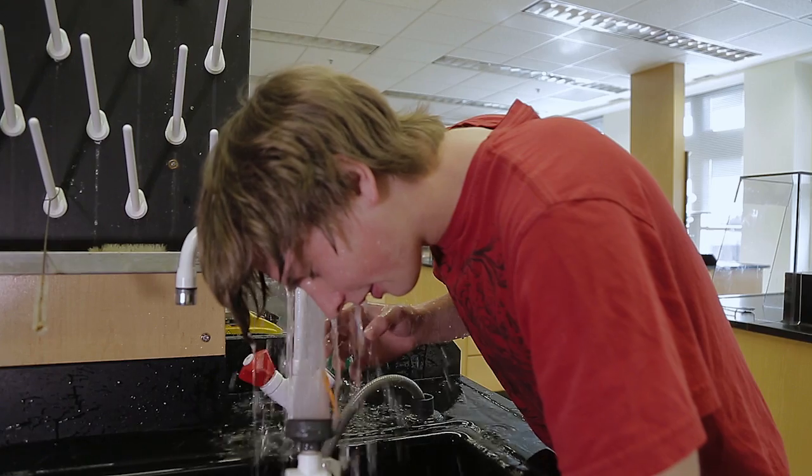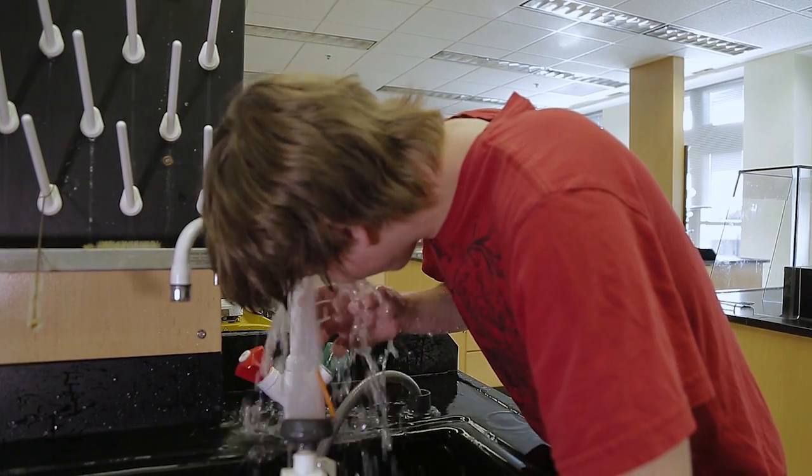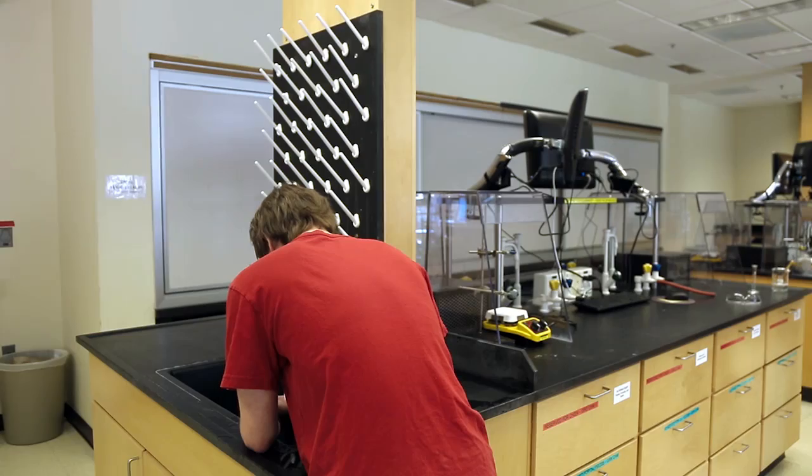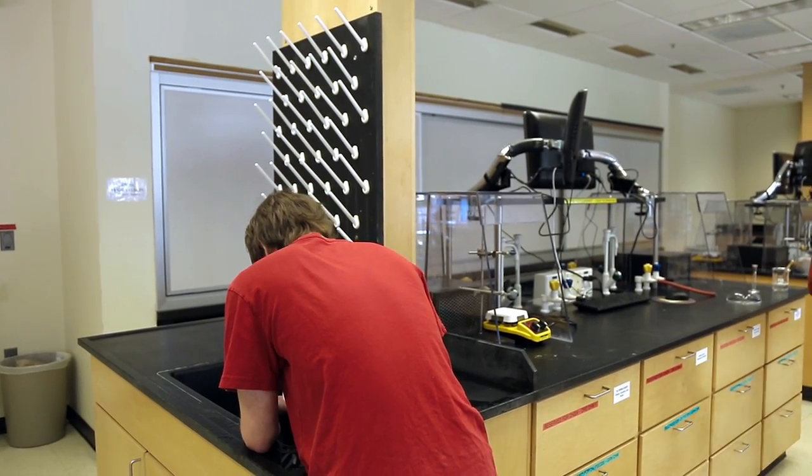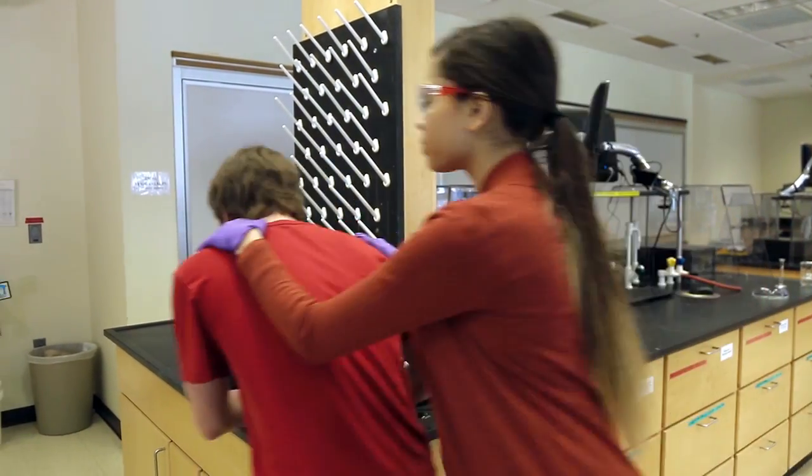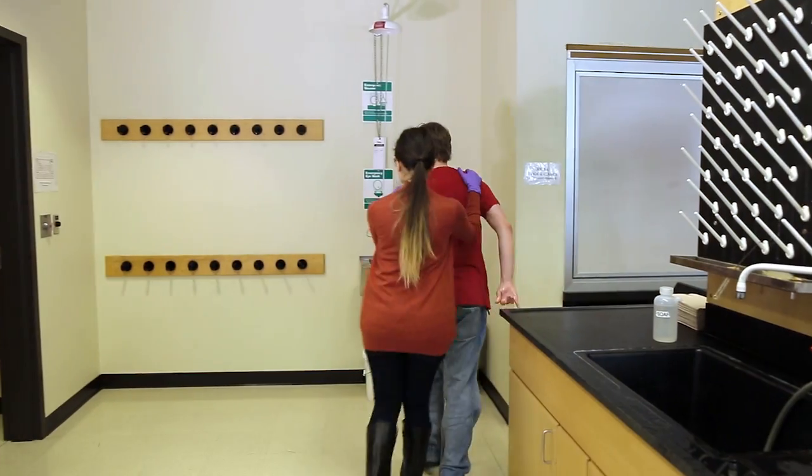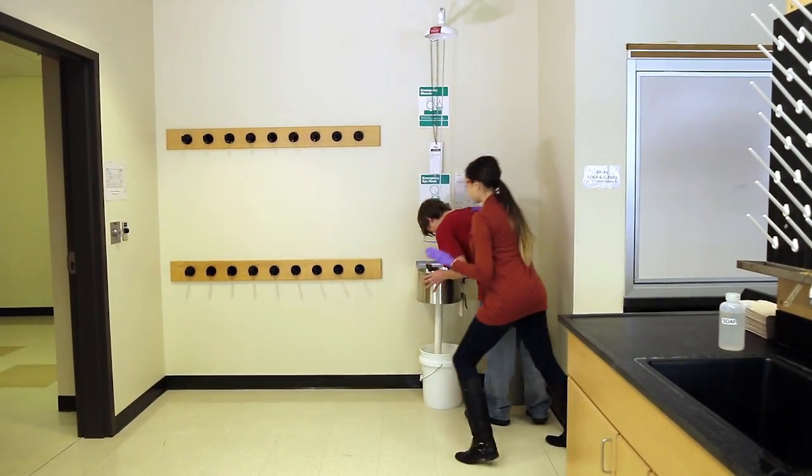Do not try to remove your contacts before washing your eyes. This will use precious time and could cause further injury. As soon as someone can assist you, move from the eye soaker to the main eyewash station located near the door of the lab.